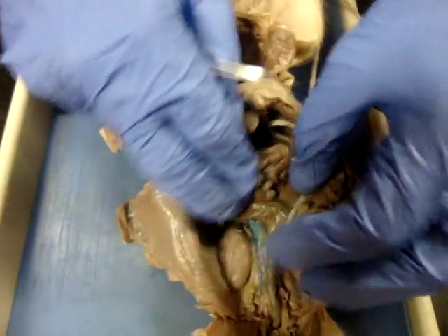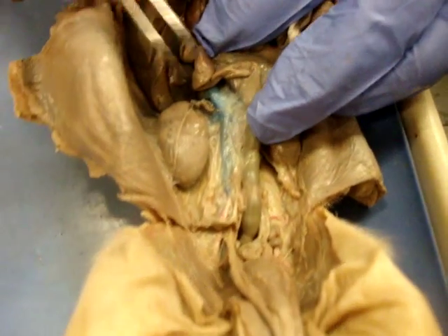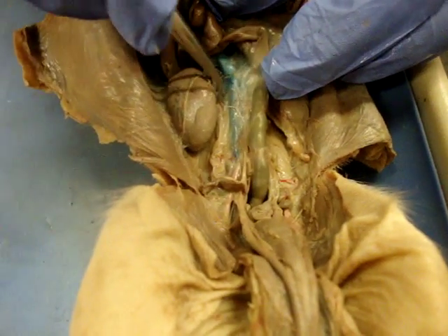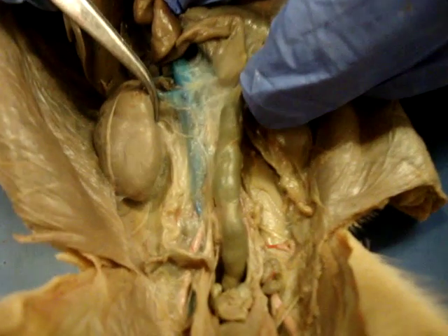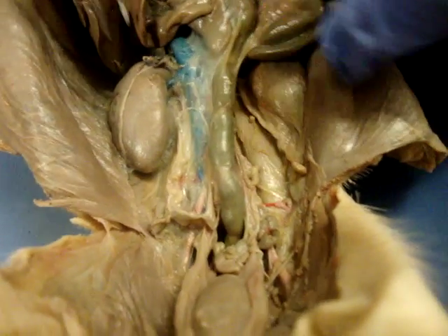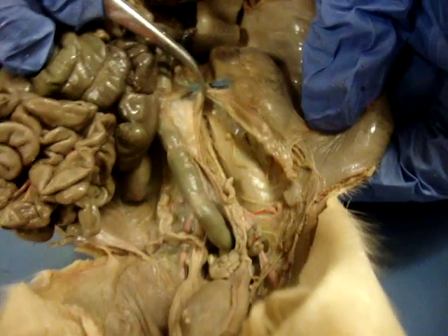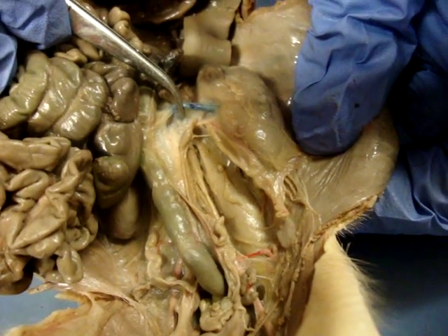Our next area — we're going to do the renal. Renal is always going to tell you something to do with the kidneys. With the renal artery and the renal vein, you're going to see them connecting from the vena cava and the descending aorta, heading right to the kidney. The blue is colored really nicely; the red latex didn't quite make it as far on this side. Renal artery is the red one, renal vein is the blue one.